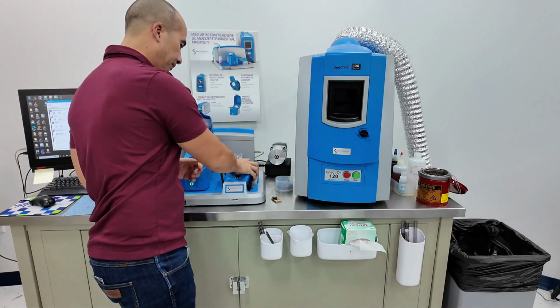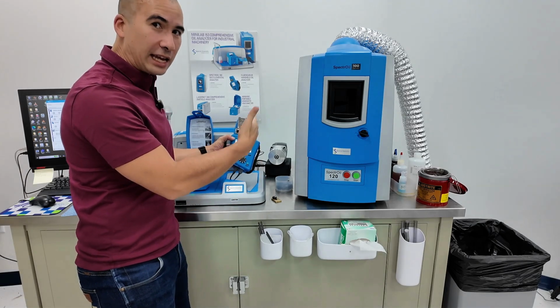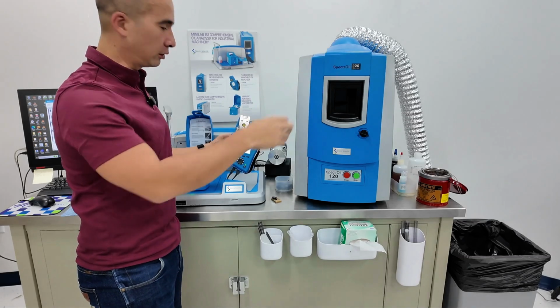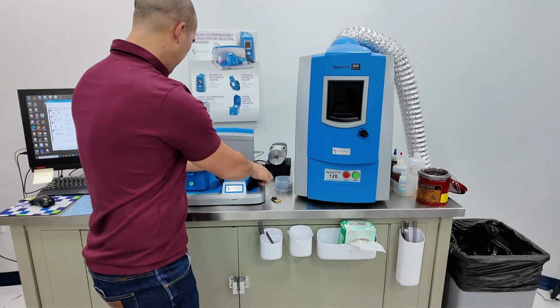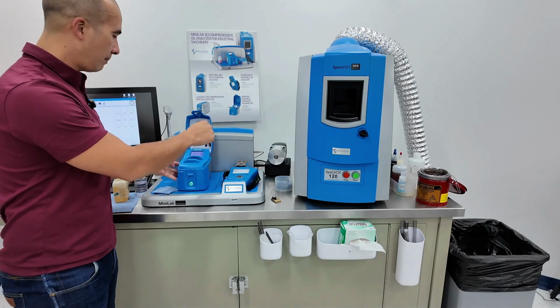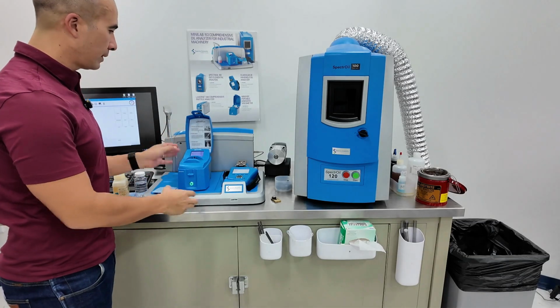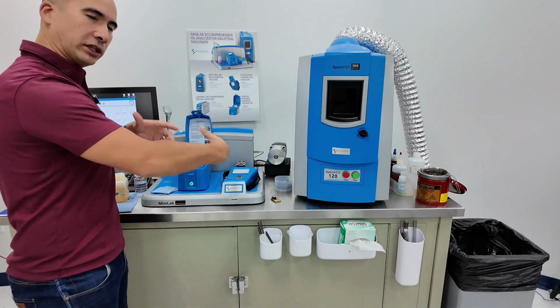As an example, this is the FluidScan, which is in the field lab. But if you disconnect it, you can actually take measurements out in the field with you. Hence it's got these handy holders. Exactly the same thing here. This is the MiniVis, the viscometer that was inside the field lab. Again, you can remove this and take it with you if you really want. When it all sits on this bed, it is part of the MiniLab and all the data is integrated.